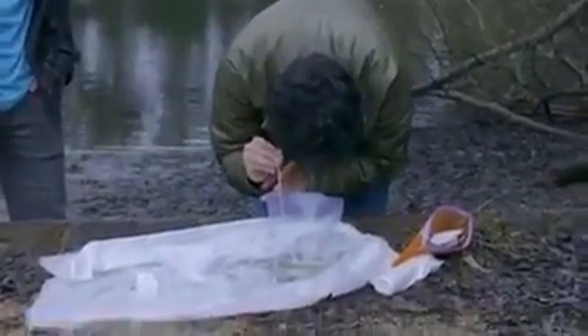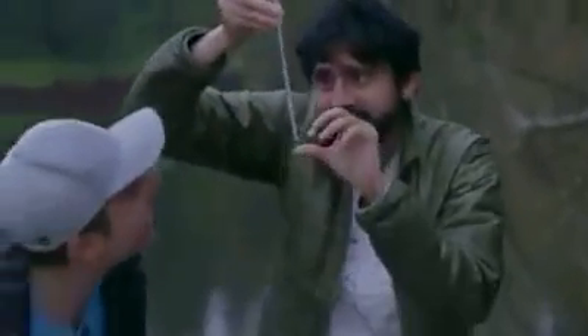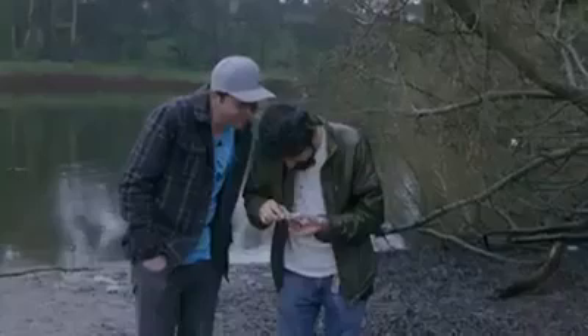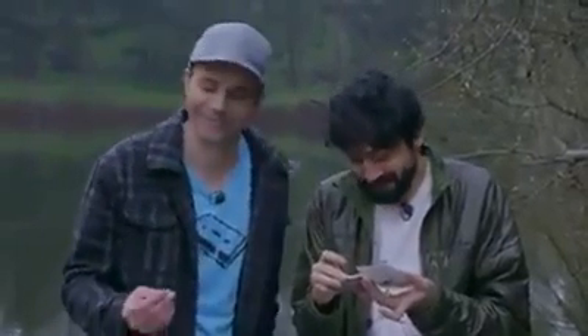But I think I'm gonna get it. You got it. There it is! And remember, to the naked eye you can barely see this tiny white speck. Whoa — that's the single eye, you see that? And then we look at the back. Those are the egg sacs. Dude! So this might be 10, 15 eggs on each side. Those are antennae. Oh my gosh. So when I was sucking it in and it ran away — yeah, it senses the pressure variation through those antennae.